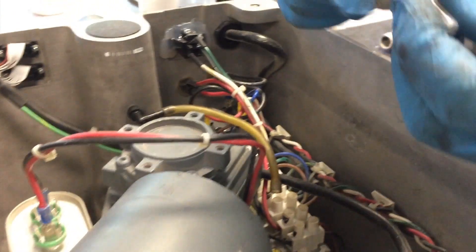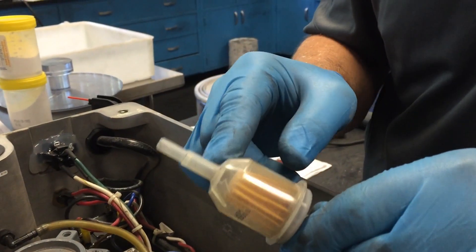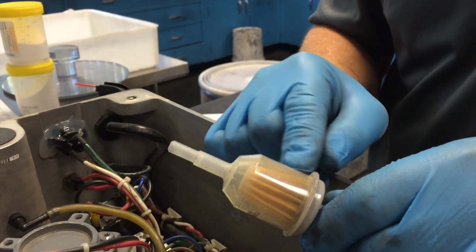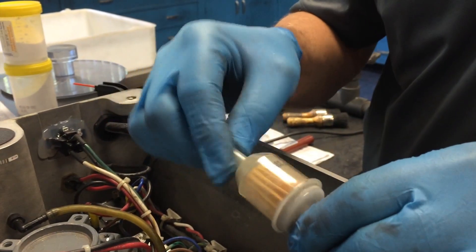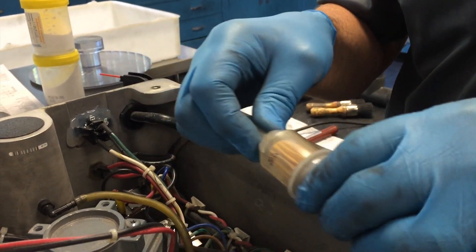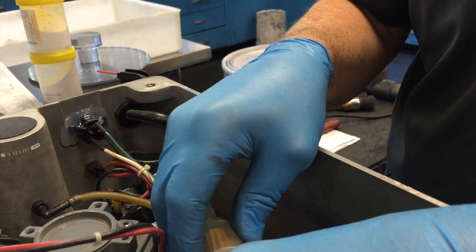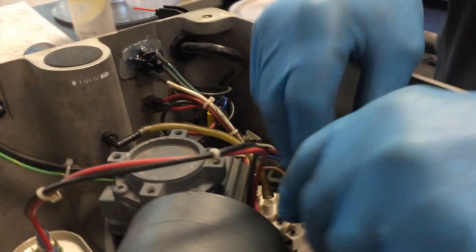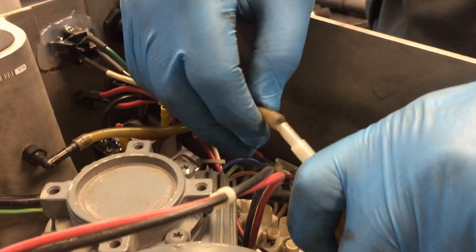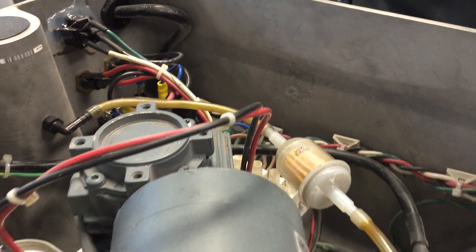Take your filter, and notice you want the clear sight, because this way what will occur is you'll see any material buildup. That'll be your prime indicator as to whether you should change the filter or if the filter has accumulated material. Pressure fit, and you're complete.